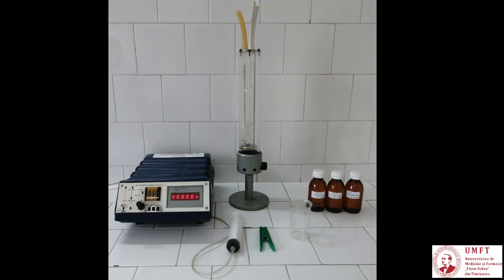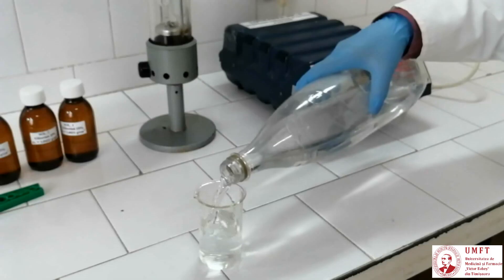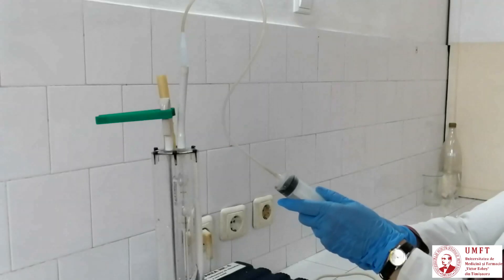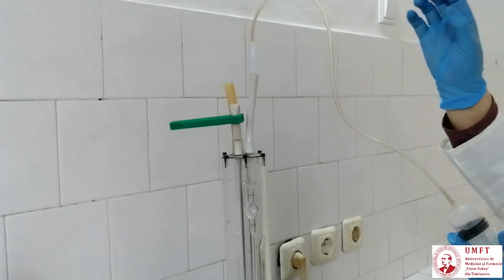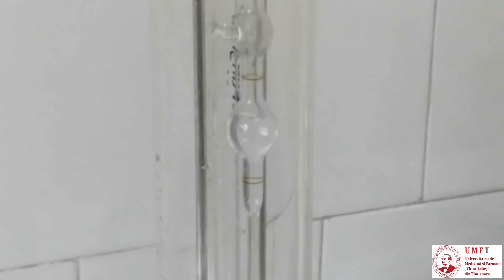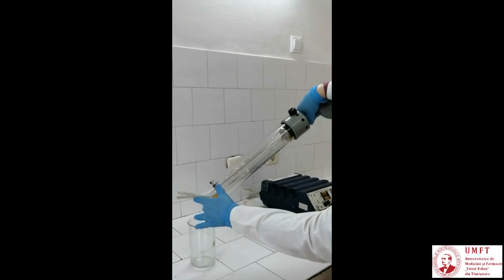Before and after each measurement, rinse the interior of the viscometer with distilled water. Using a Berzelius glass, fill the lower reservoir with distilled water to a level between the two marks. Block the ventilation branch using a clamp. Connect tightly the syringe hose to the branch with the upper container and, by suction, pull the water in this branch to a level above the second mark. Release the syringe hose, then the clamp. After emptying the capillary branch, pour the water out through the same branch it was filled through. Grab the viscometer by the bottom metallic part and tilt it to remove the contained liquid.